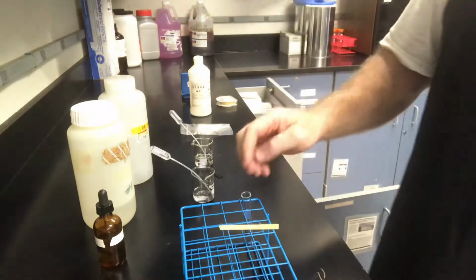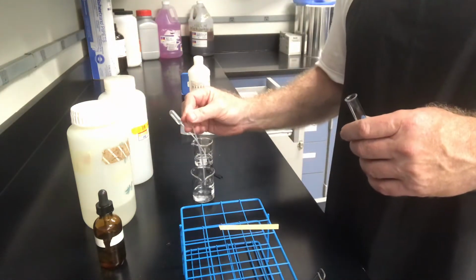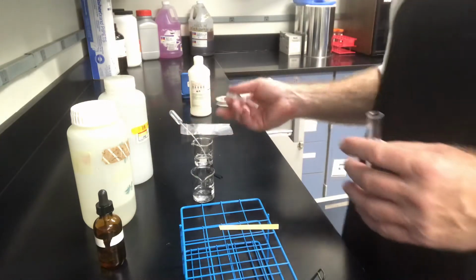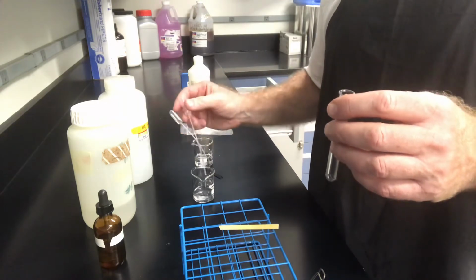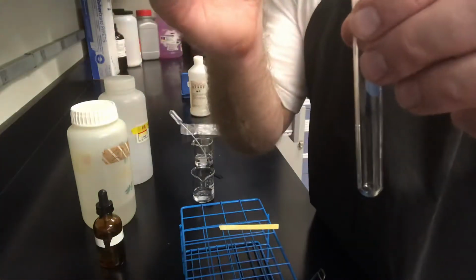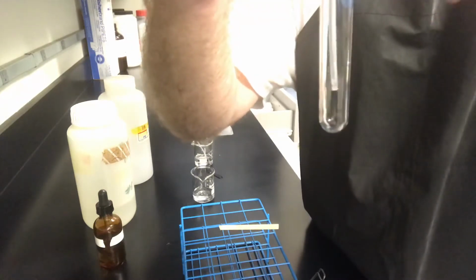Okay, so what I have is a test tube here, and a dropper pipette. I took 2 dropper pipettes of equal volumes. This is the acid, and that's the base. When I add the acid to the test tube, I'm going to add 10 drops. Adding drops is not the easiest thing in the world because you've got to get them right down there and you've got to count right. Okay, here we go. Can you see that? Okay.